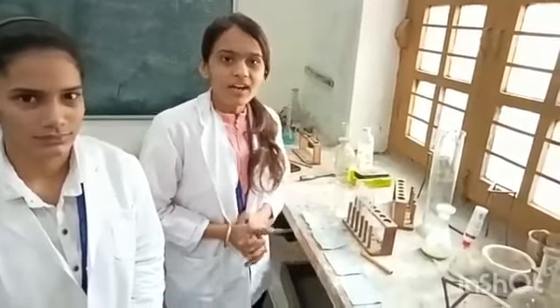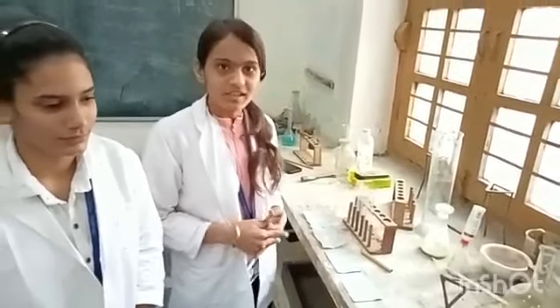Good morning, my name is Preya and Sinkalita. We are students of basic chemistry in the first year. Today we are here to determine the solubility of benzoic acid at different temperatures and determine the heat of dissolving. We have taken 4 different amounts of benzoic acid.